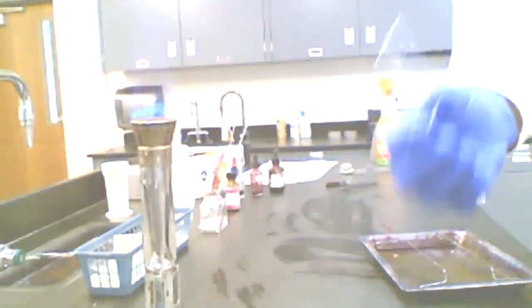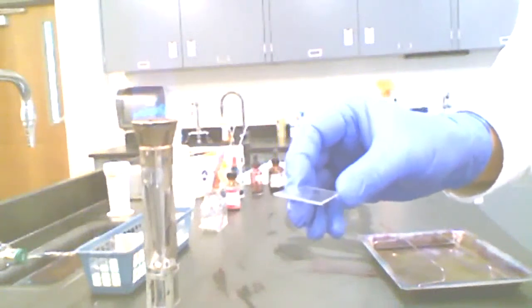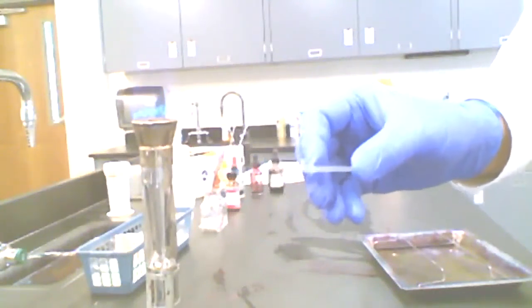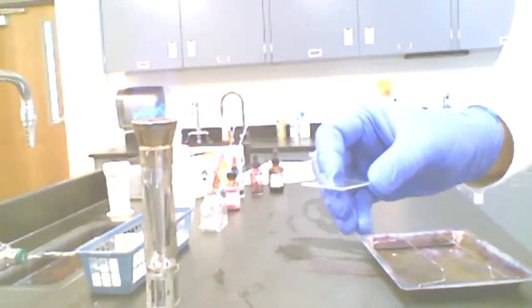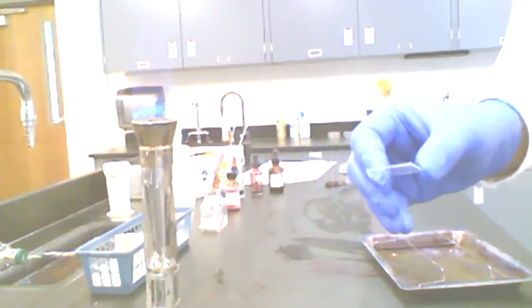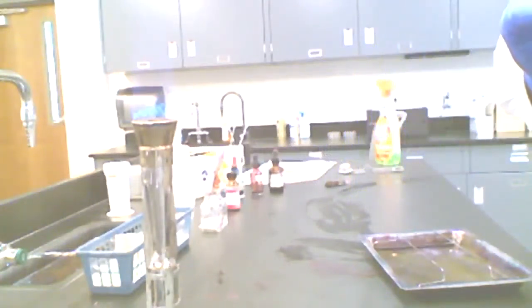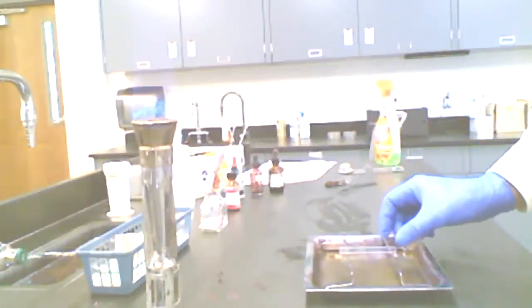This is a microscope slide. I'm going to go ahead and mount an organism on this. The first step is to place a drop of water on it. Since you're not actually here doing this, it's something initially that a lot of students kind of mess up the first time, but ultimately through trial and error, they get the exact right amount of water on there. We just need a single drop right in the center of that.